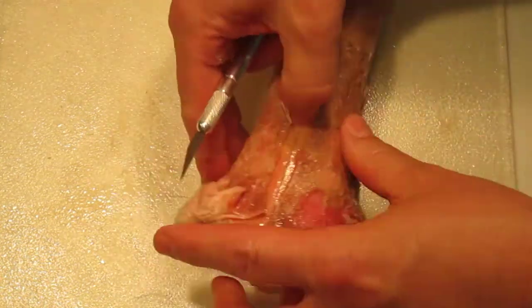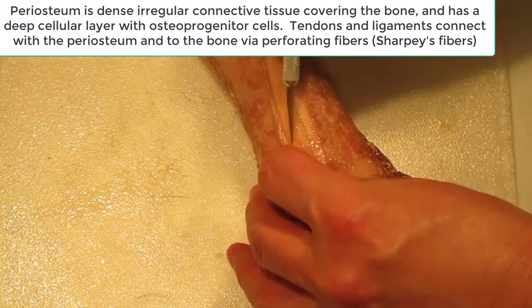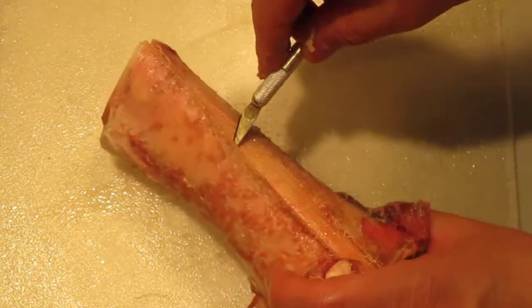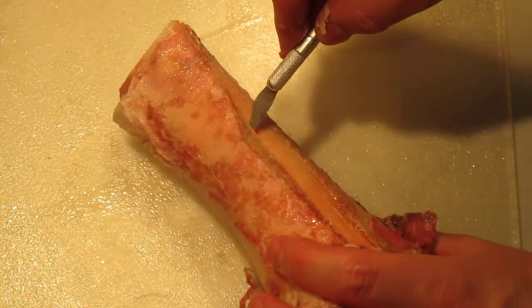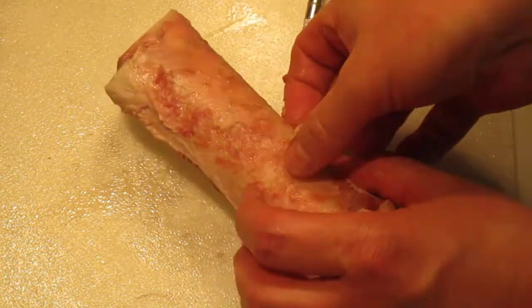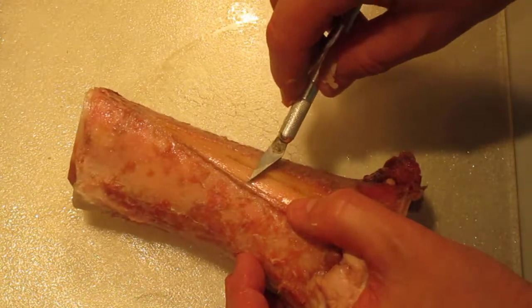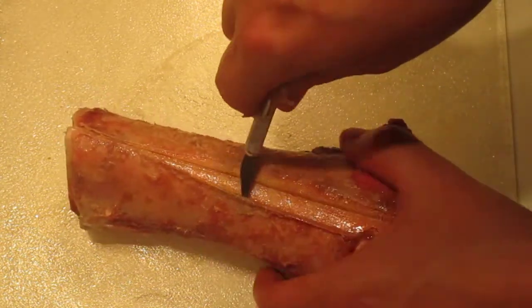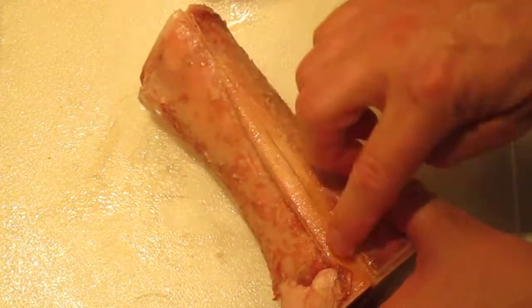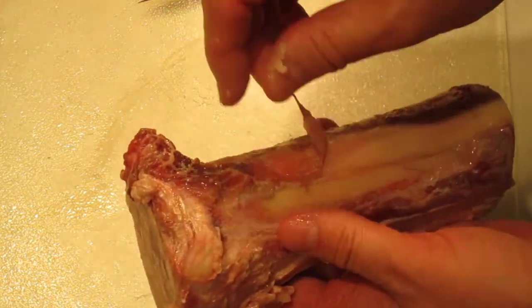You can also see the periosteum along here. Let's peel that back — here's your periosteum. We can dissect off a little bit and pull it back away from the bone so you can see underneath. It's a dense irregular connective tissue layer over the bone. It's very tough — I can cut through it but I can't pull through it very easily — and it goes the whole length of the bone.